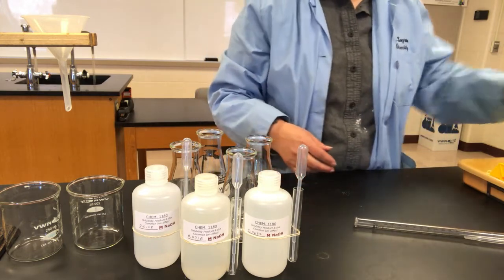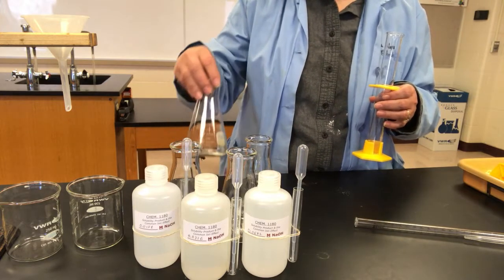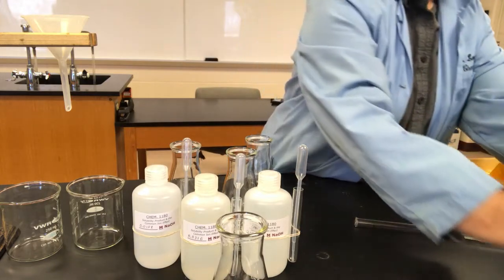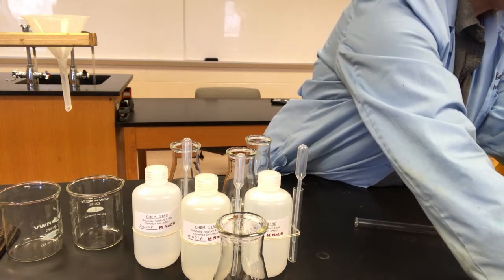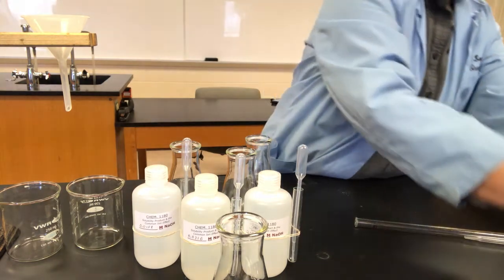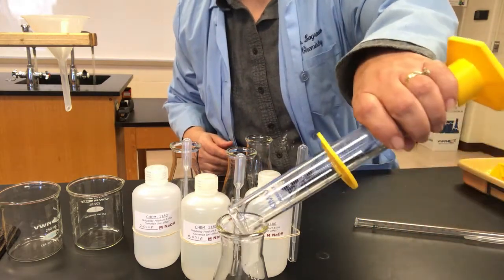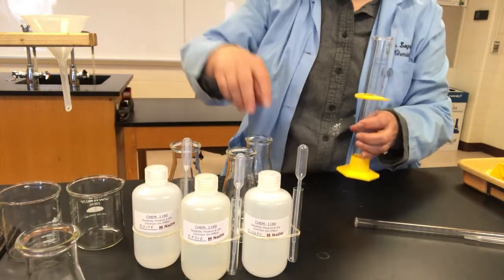Now I'm going to dissolve each of them into the substance in which I have labeled them to be dissolved. So the first Erlenmeyer flask is to be dissolved in just water. So we're going to add 50 milliliters of water to our first Erlenmeyer flask. You do want to be as careful as possible with this because you do want to saturate it, but the exact amount's not that important because the concentration will stay. So we're going to make sure that will dissolve. I'm going to put that aside to look at our next flask.